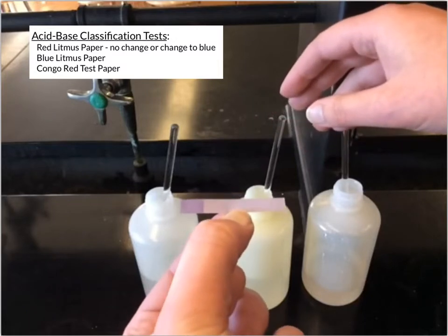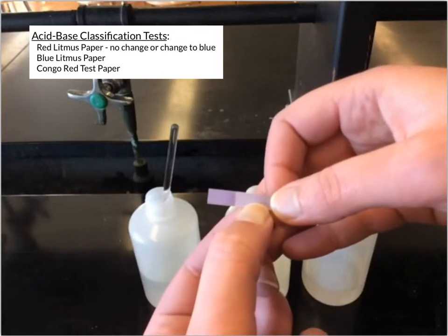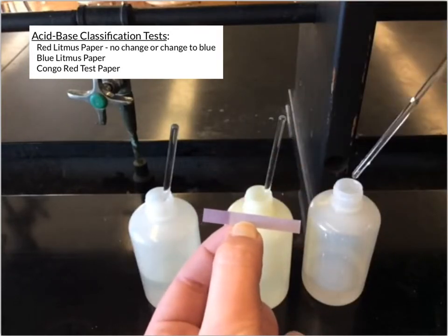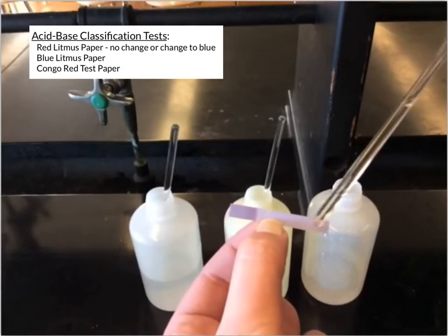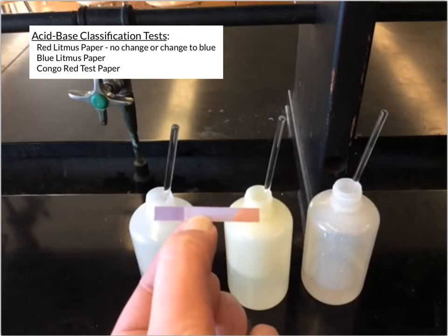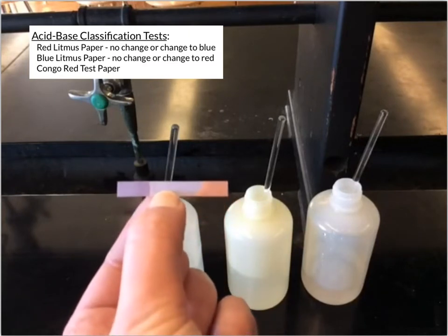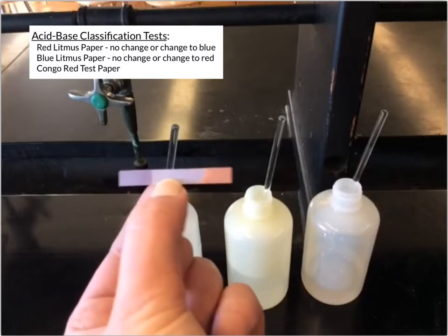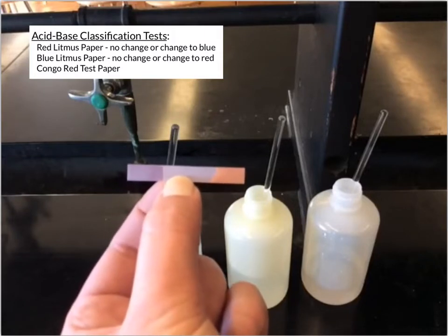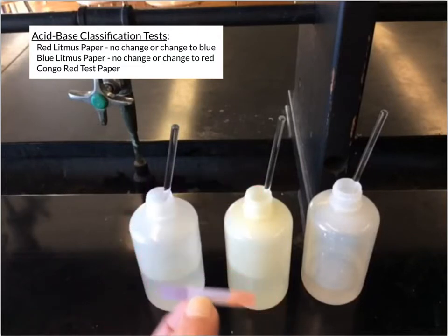It looks a little darker now just because it's wet, but there's no actual change in the color. But I can use another substance, and this substance is causing that blue litmus paper to turn red. And so those are the two different things you would see with blue litmus paper. Either it has no change or it changes to red, depending on the properties of the substance that you're testing.